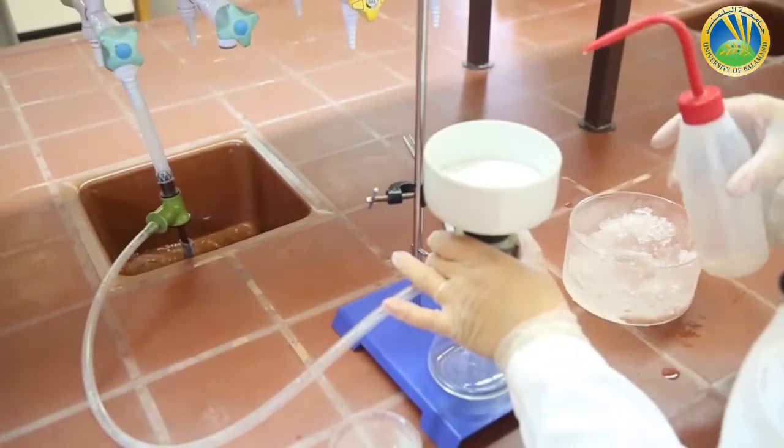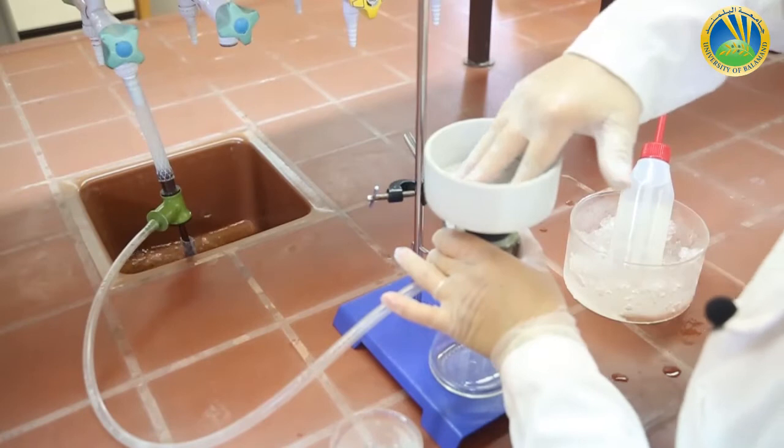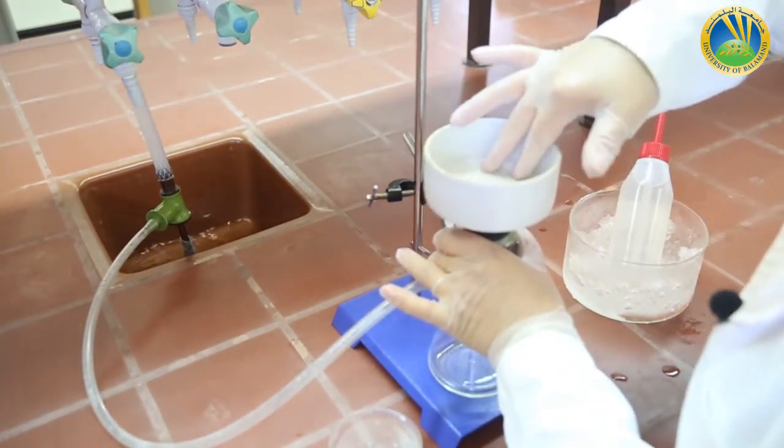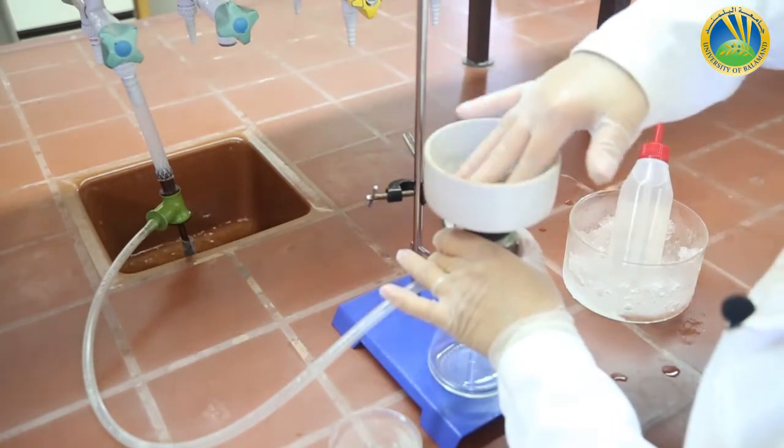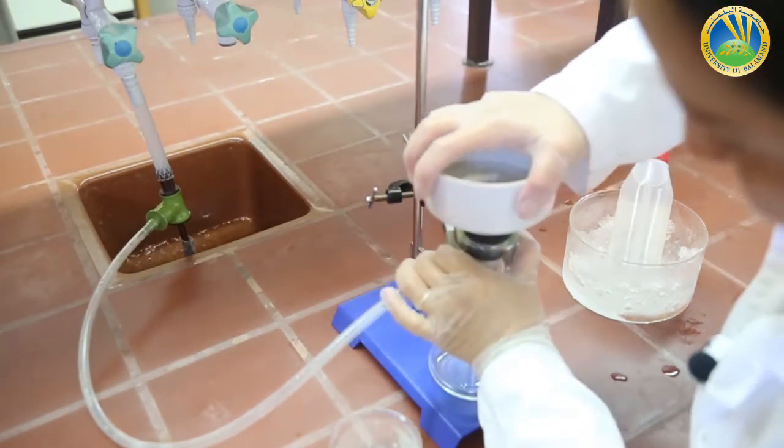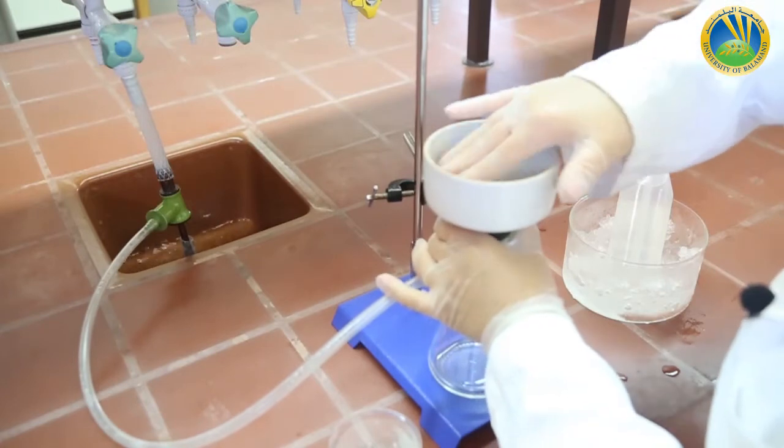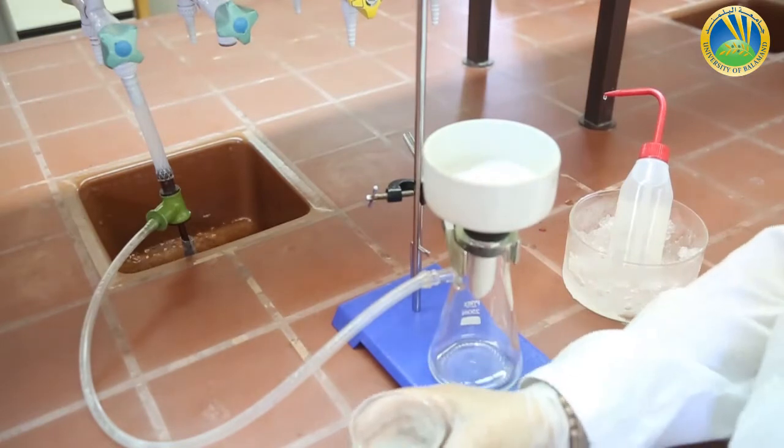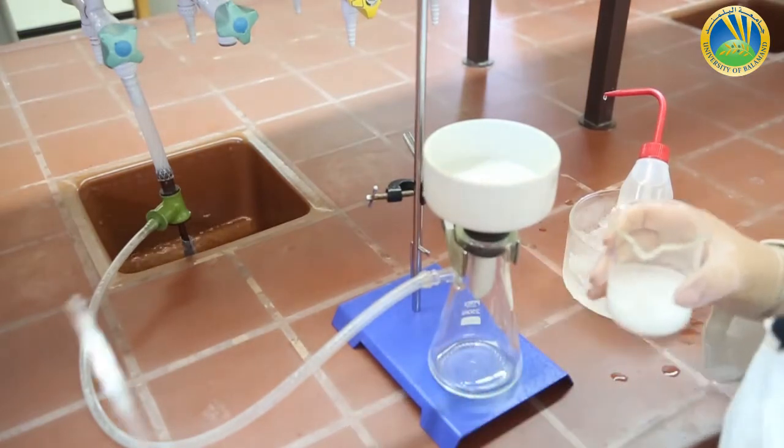With a little bit of cold water I will let this filter paper stick inside my funnel. Now my Buchner filter is ready for filtration.